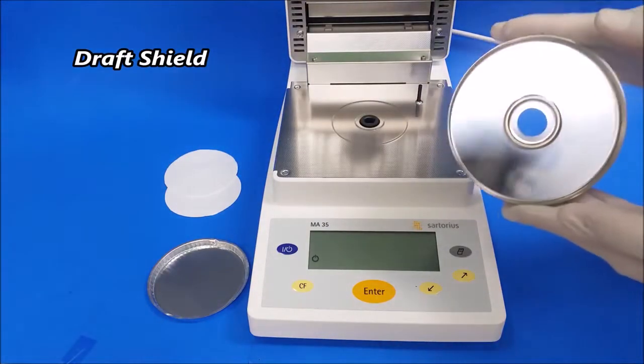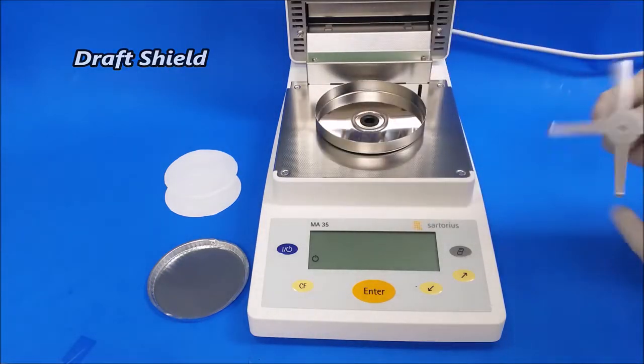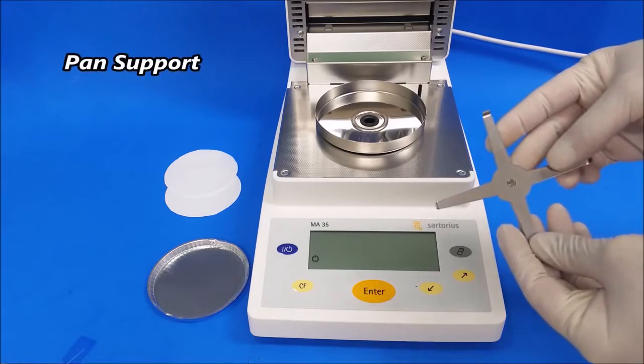We're going to put in the draft shield first. Next will be the pan support.